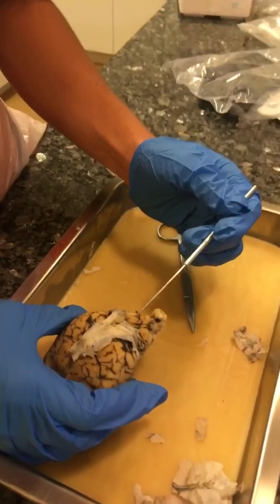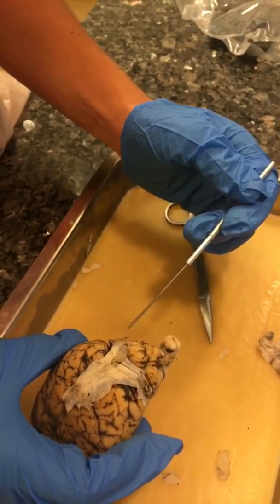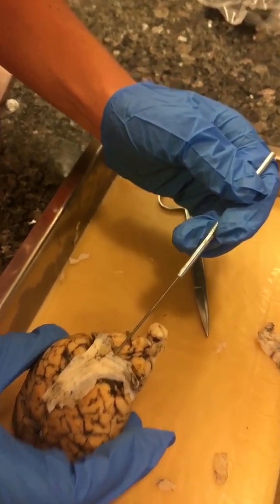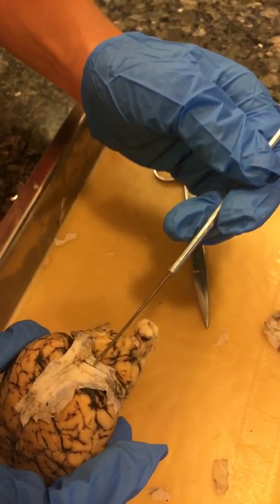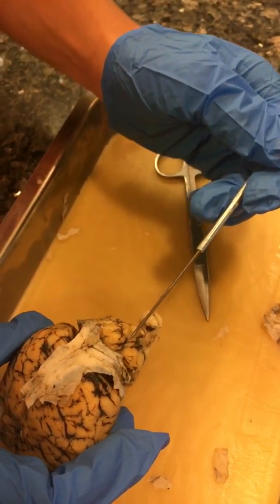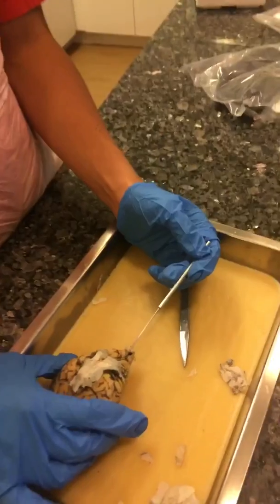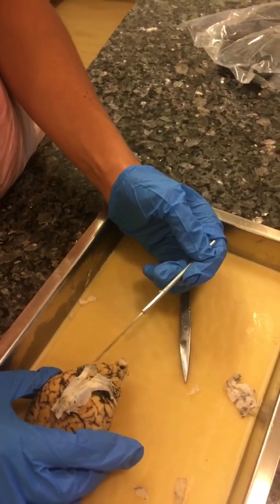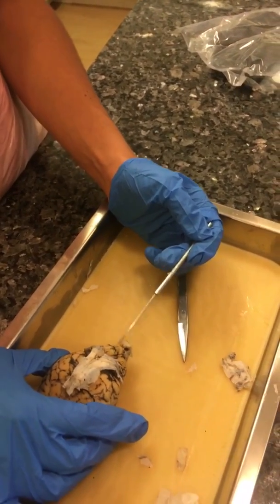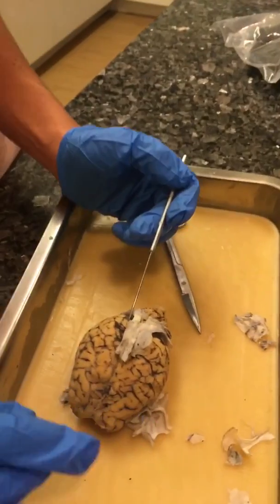This structure back here is the cerebellum. Down the middle, it's hard to see, but this is where the vermis should be. Either side makes up the lateral hemispheres.